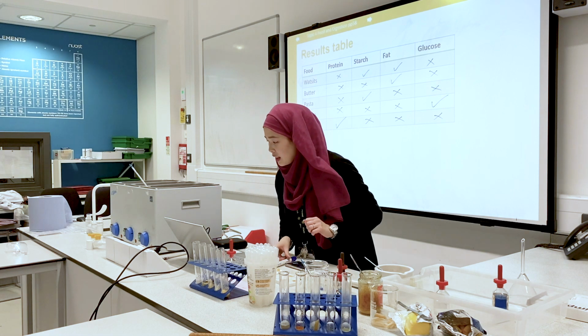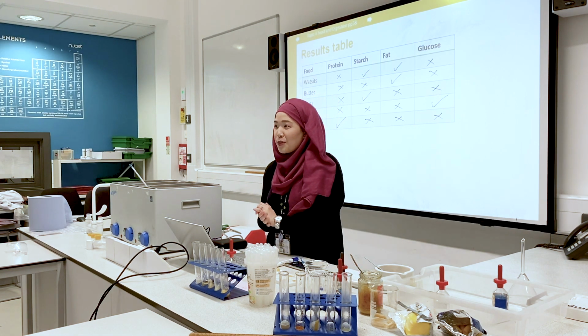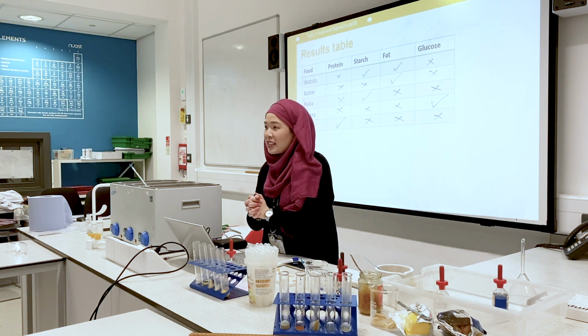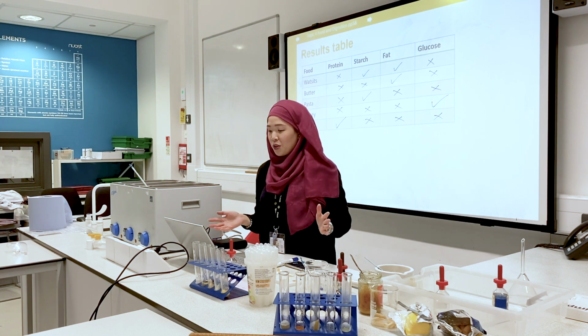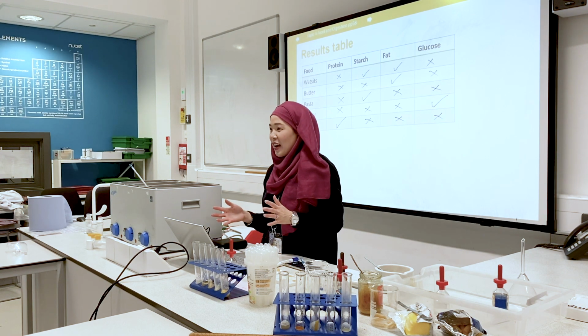Okay, so thank you for joining me today for this practical. I hope this has helped with your knowledge about testing foods for protein, starch, fat and glucose. Thank you and have a good day.